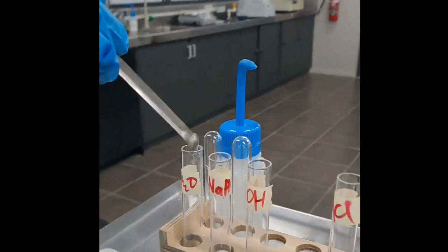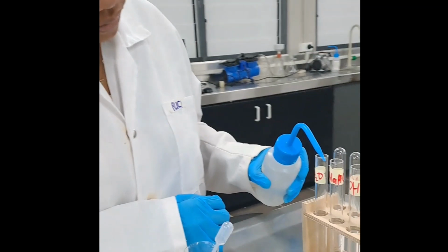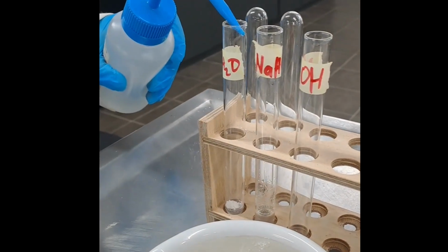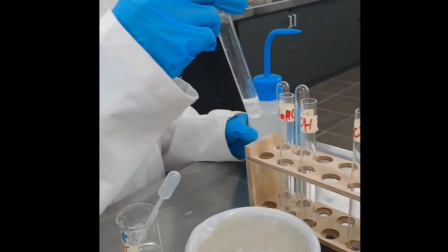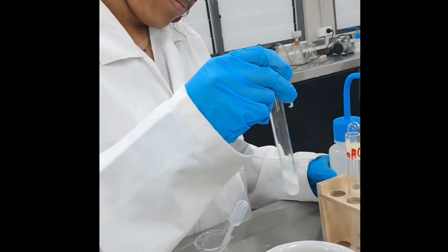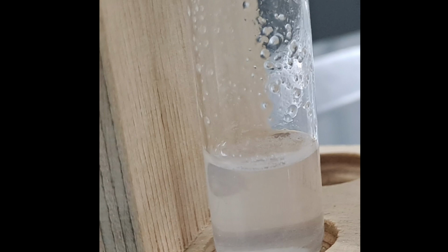As you can see, a small amount of the unknown substance was added to the test tube labeled water, and a few drops of water were added into the test tube. After adding a few drops of water, the test tube was shaken properly and observed. Here is an overview of what the mixture looks like. It can be concluded that the substance is insoluble in water. Since the substance is insoluble in water, we have to check its solubility in the other reagents.